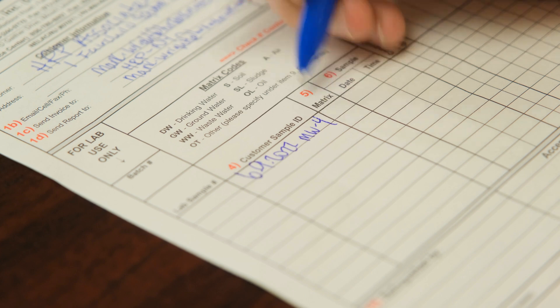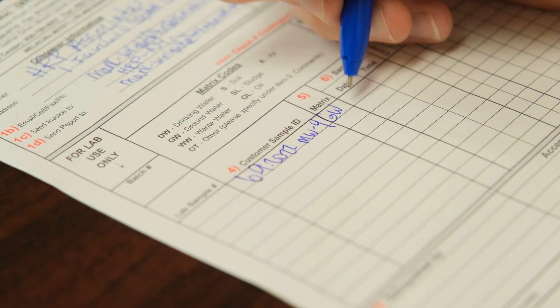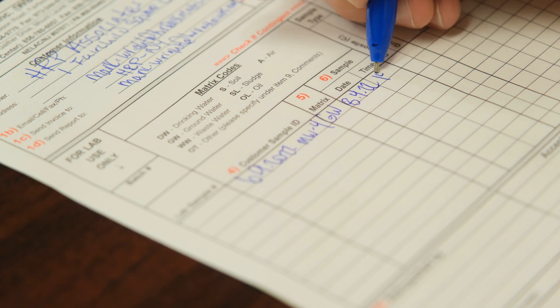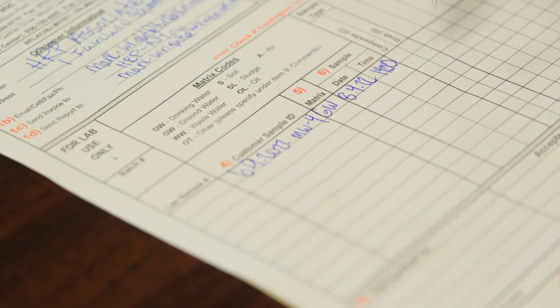For the matrix column, it's always going to be how you collected it — is it a soil sample, is it a groundwater sample, is it an air sample? Make sure you get the date, and your date should always match your sample label on the actual bottle that you collect your sample in. Time is always military time.